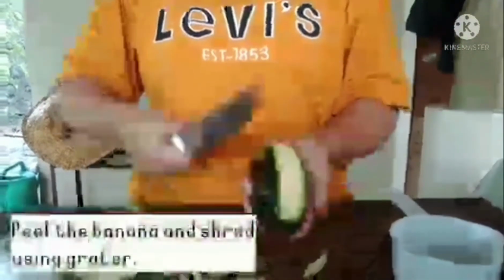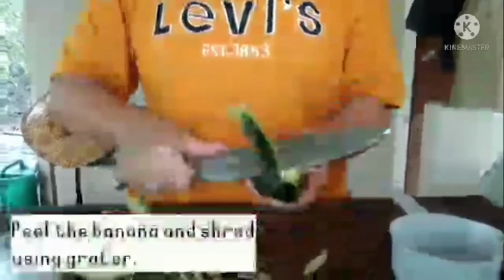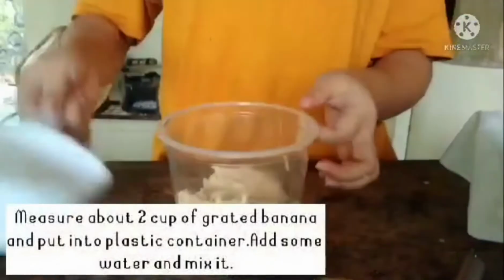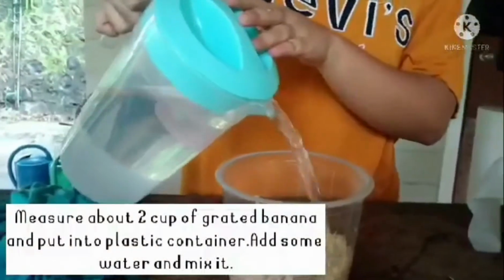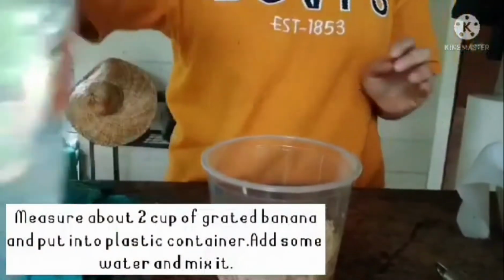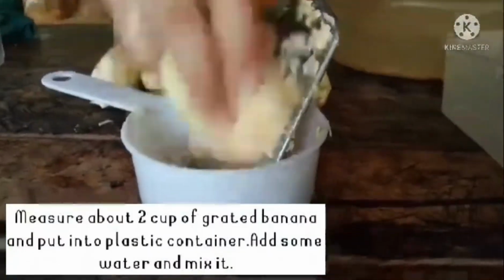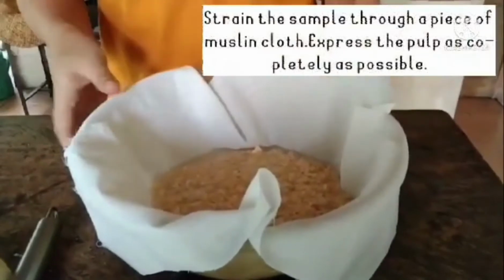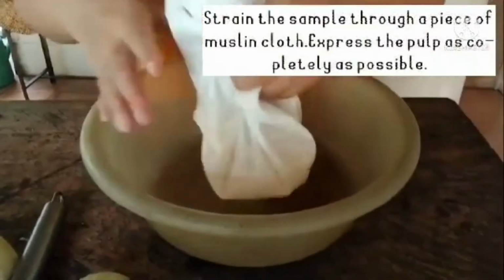Peel the banana and shred using a grater. Measure about 2 cups of grated banana, put into a plastic container, add some water and mix it. Strain the sample through a piece of muslin cloth and express the pulp as completely as possible.